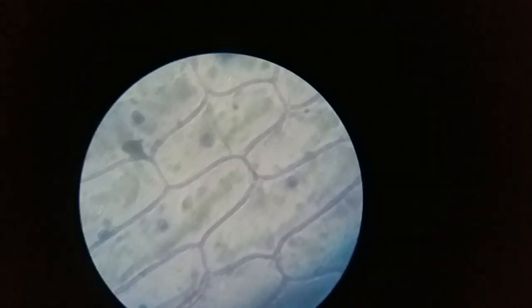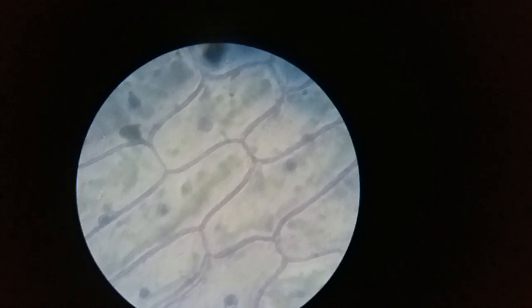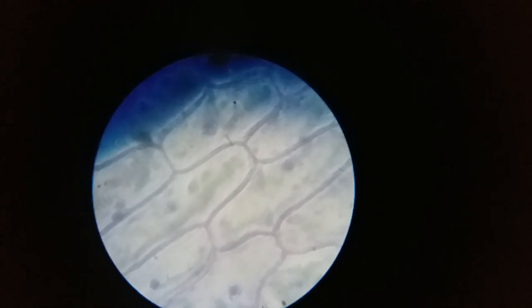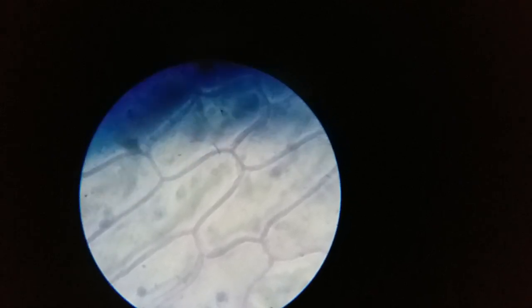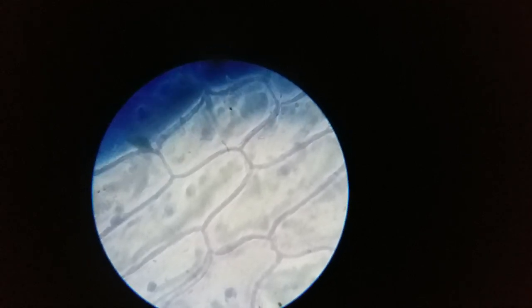Now we will observe this slide in the microscope. Now we will observe this slide.